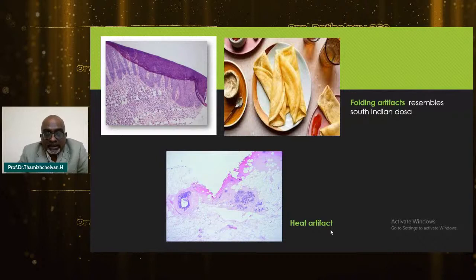What we have found is that the majority of the artifacts, the major problem here, are folding artifacts, which are very common. Interestingly, these folding artifacts also resemble the favorite masala dosa, which is served by both North Indians and South Indians. The tissue can show a similar fold, which can be easily avoided. The minimum artifact seen is the heat artifact.